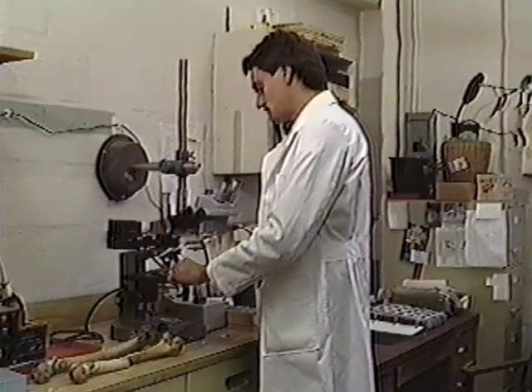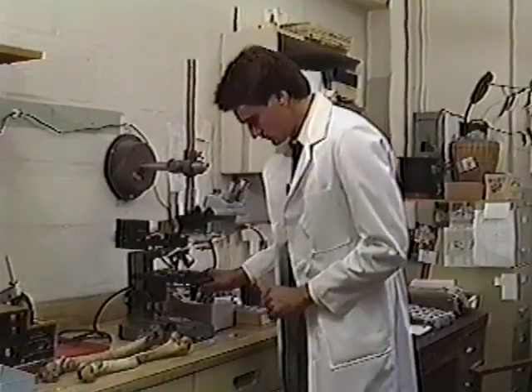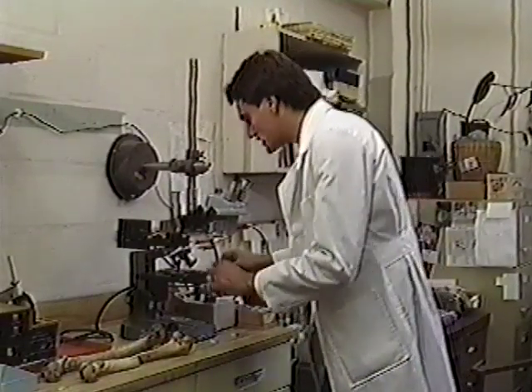If we go to the next slide, which is an individual in the mid-40s, you can see a change in frequency of structures. At this age, you're getting a higher frequency of bone remodeling structures. By bone remodeling structures, I'm talking about the osteones, and actually the osteone fragments. These are simply osteones that have been eaten through by newer osteones.